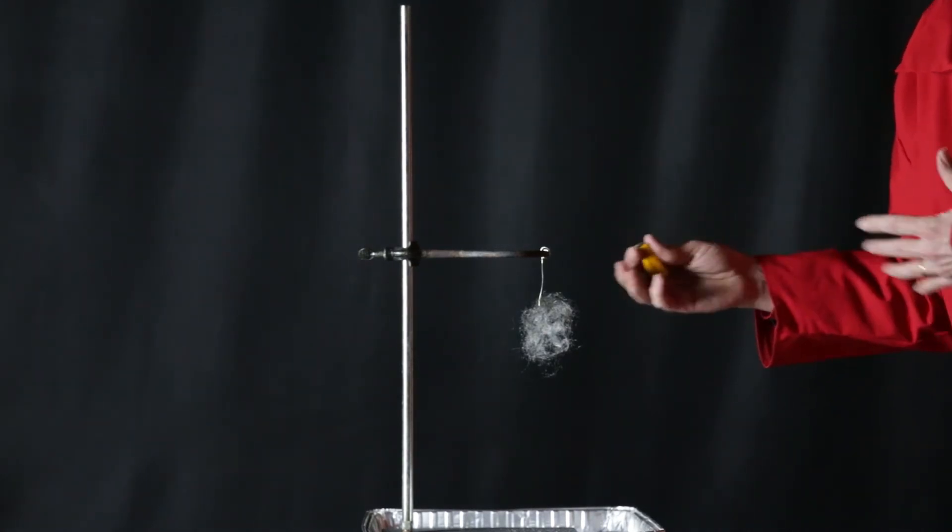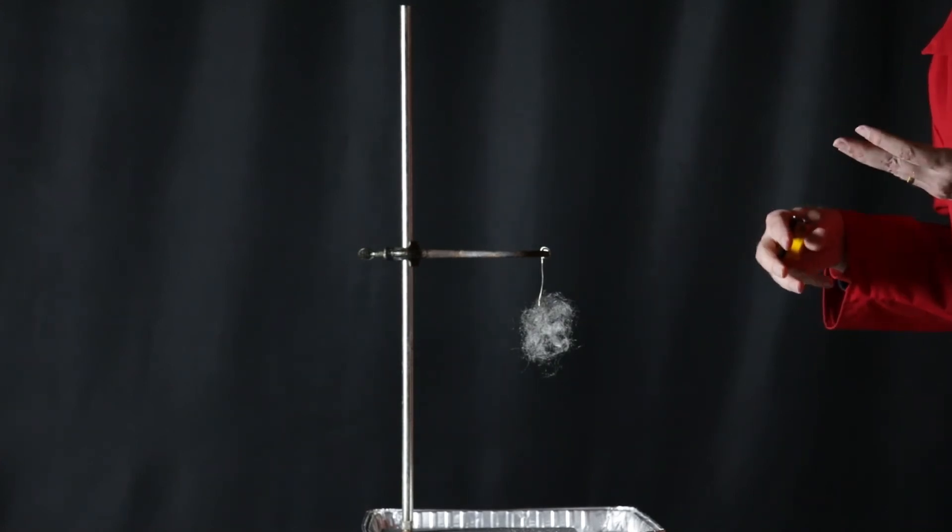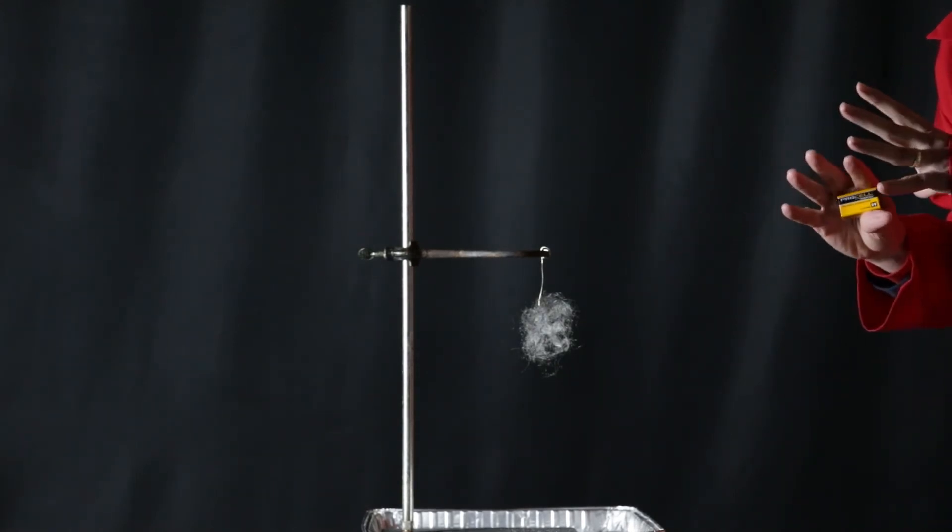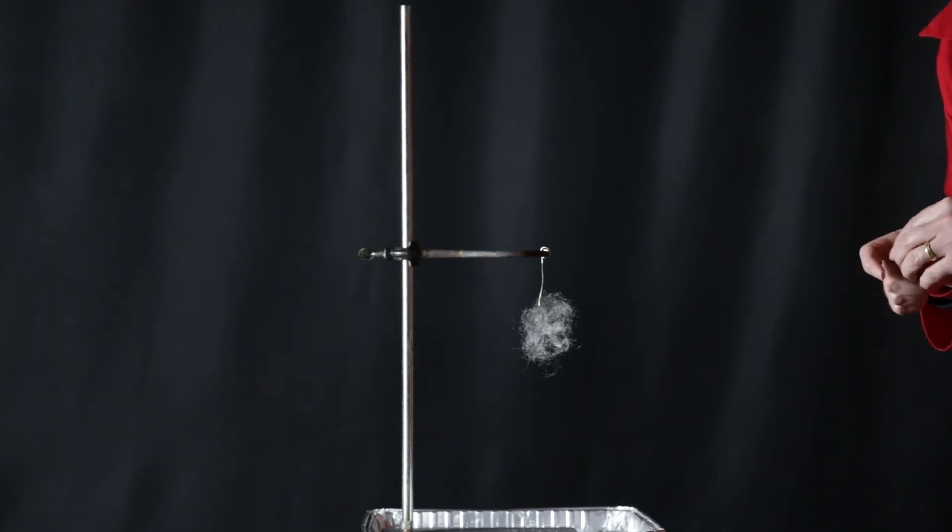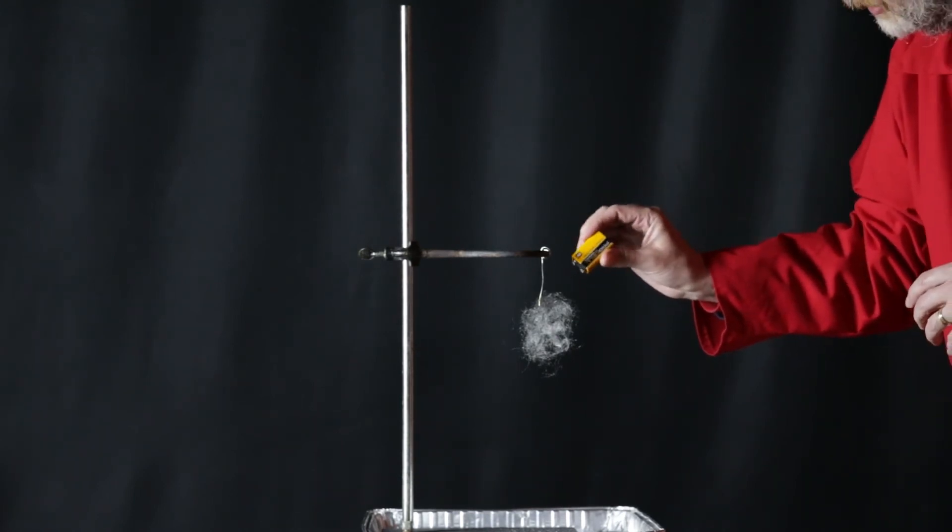And then I'm going to start that steel wool burning. So we're going to watch it once here. You're going to be kind of far away, so you're not going to see it very well. But then I'm going to turn off the lights and show it to you in a little bit better, more zoomed in fashion. Really, really looks super cool. So, combustion of steel wool.